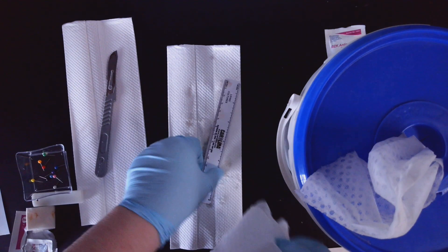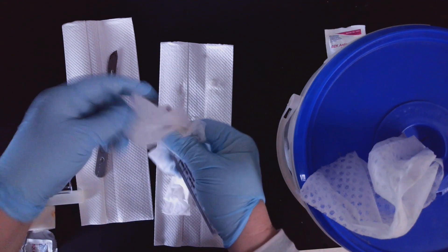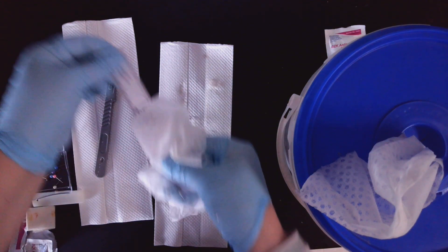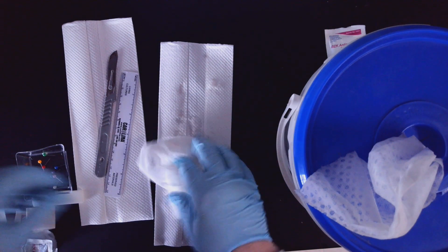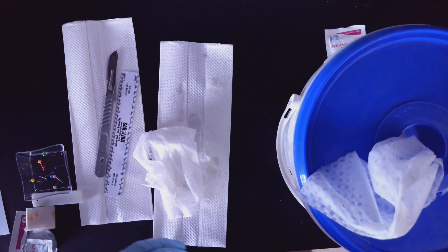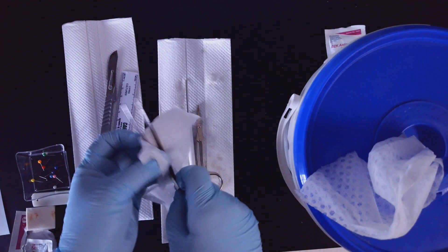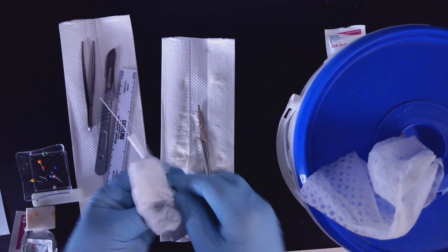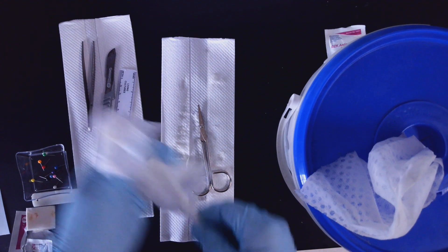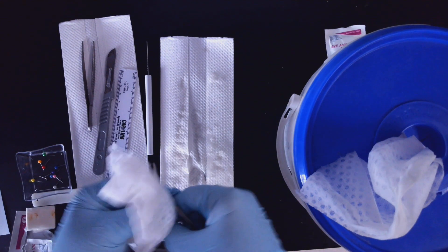Otherwise that's silly, right? I used this so I'm going to clean this off really well with these wipes. I am going to clean off the other tools I used, so I'm going to clean off the tweezers - even if you don't think you used them very much, still wipe them off - and then the scissors. Wipe those all off.